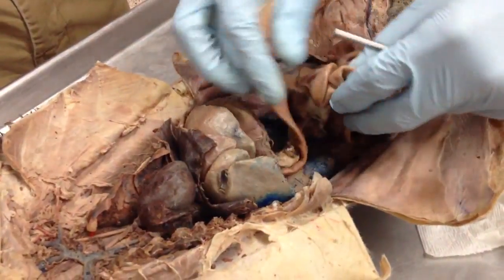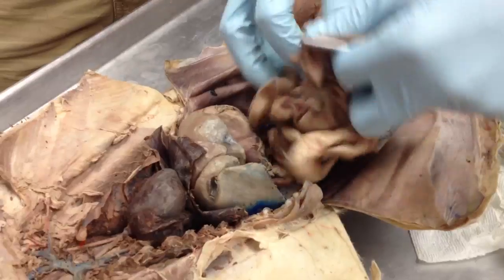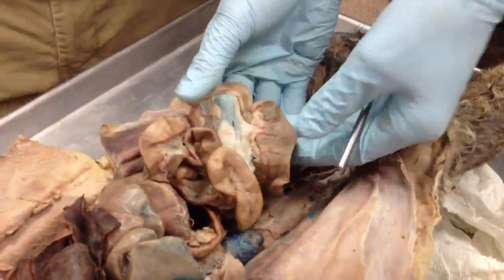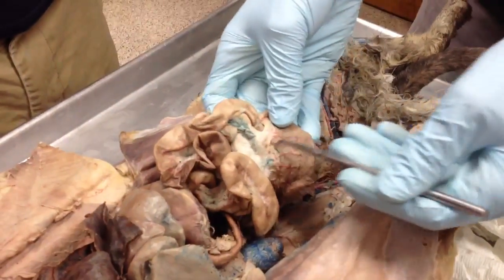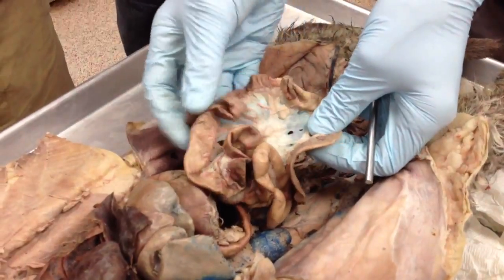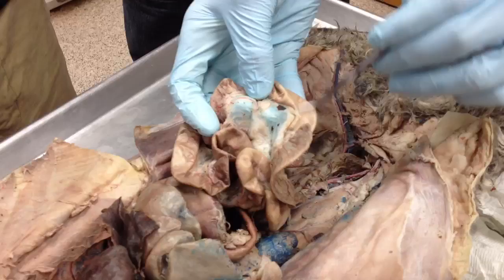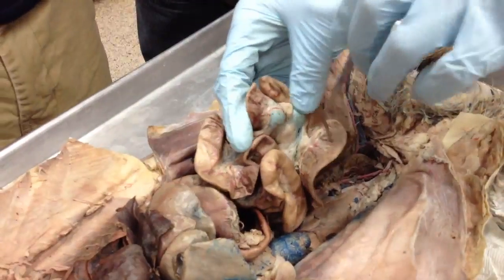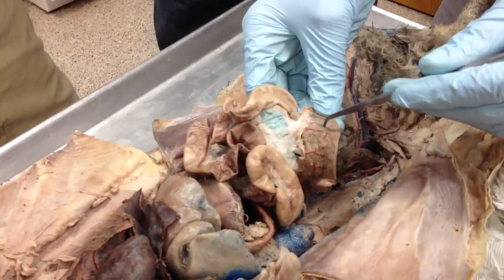And then you just trace it down. So it's like the majority of your small intestines right there, and it eventually ends right here. So small intestines, much more narrow; large intestines, much larger. This last part, you notice how that kind of has a certain structure to it. This last part of the small intestines is your ileum, and that dumps whatever, I guess, hasn't been absorbed, all the waste product, into your large intestine right here.